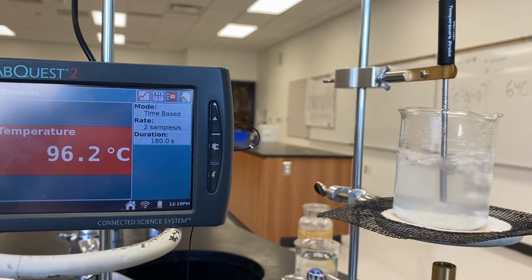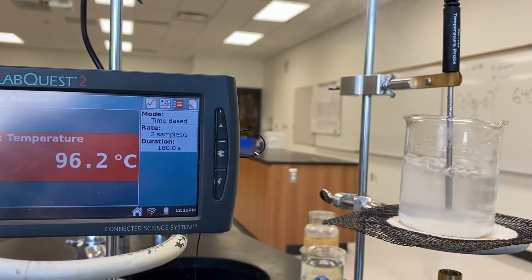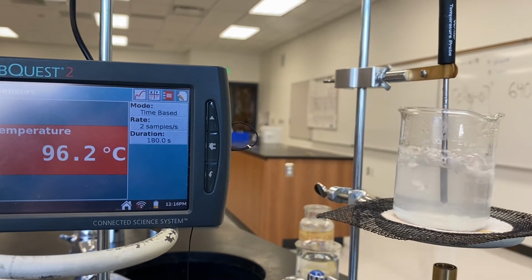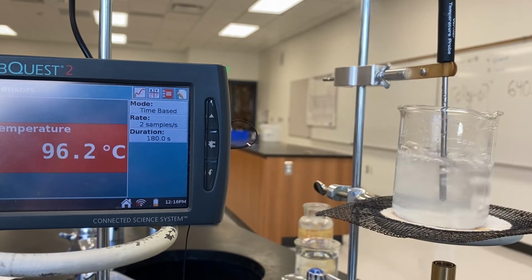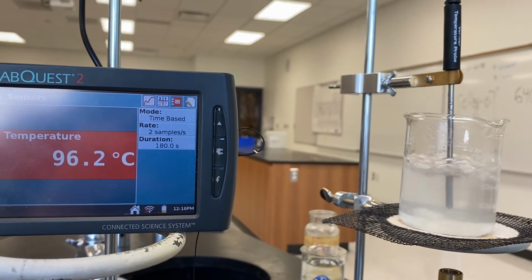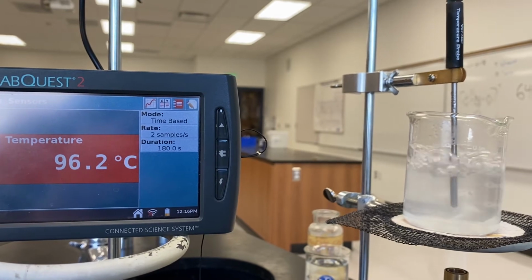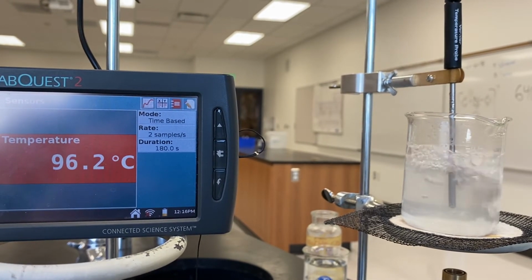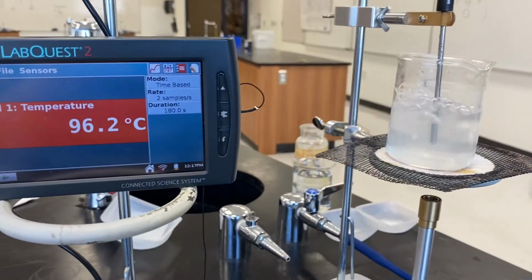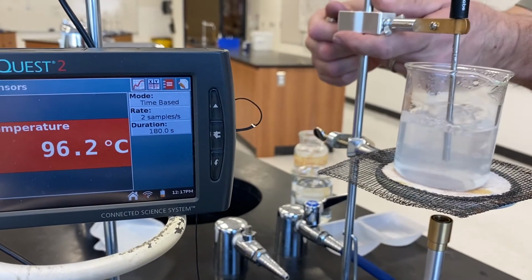Yeah. Alright, so we're at 96.2. Let's give it another 30 seconds. Sweet. Call it? Sweet. Alright, so we're going to call that 96.2. Alright, 2 more trials to go.